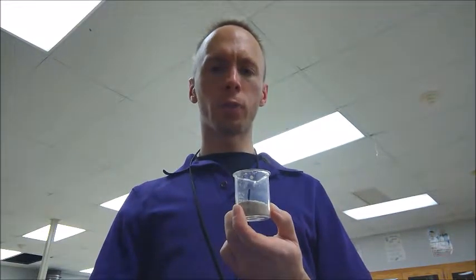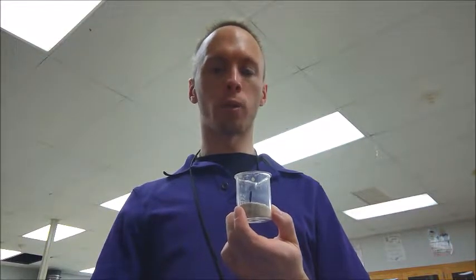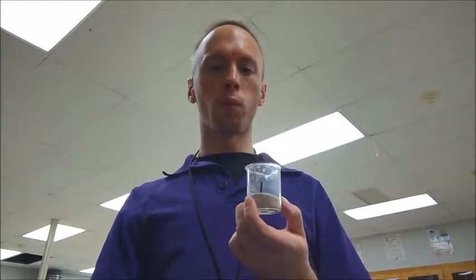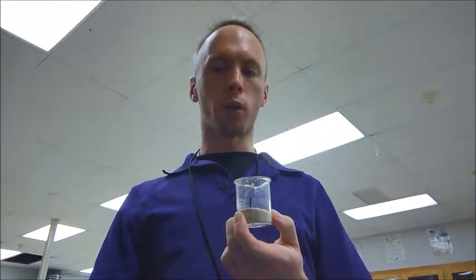For this lab practical I'm going to give you a small beaker of sand and table salt also known as sodium chloride. Make sure to read over the SDS for Sand, Sodium Chloride, and Sodium Chloride Solution before beginning this lab but they're all pretty safe to work with.